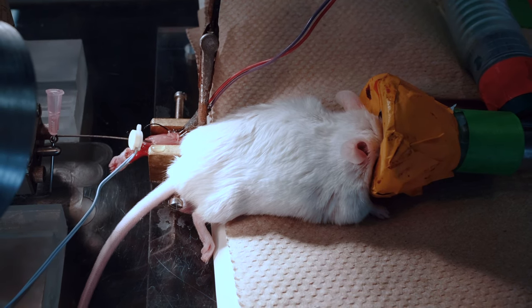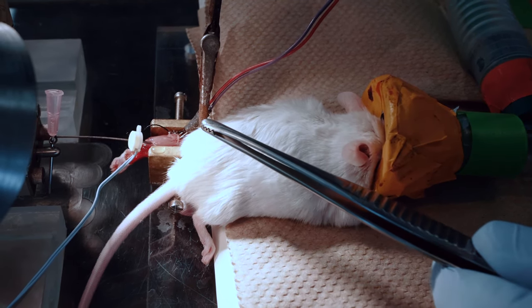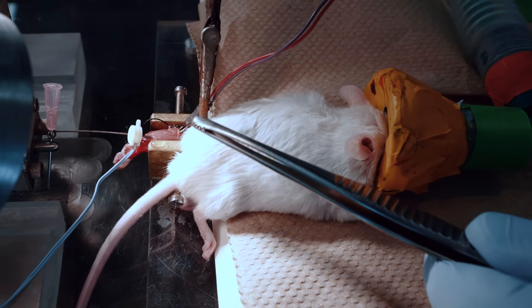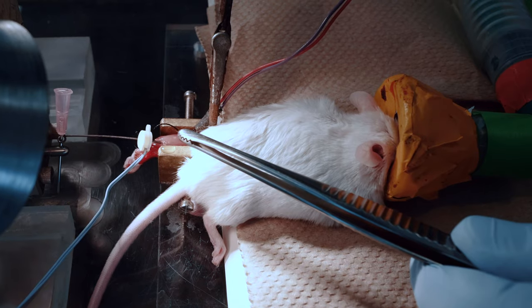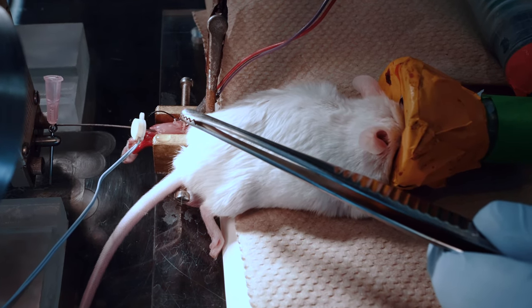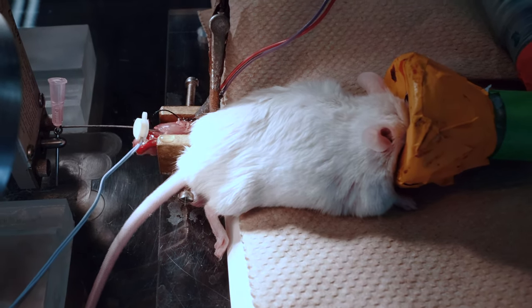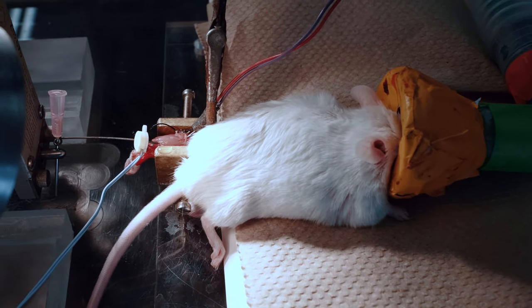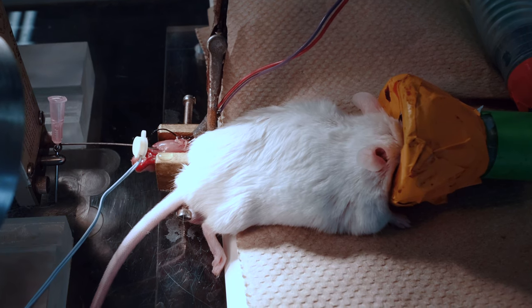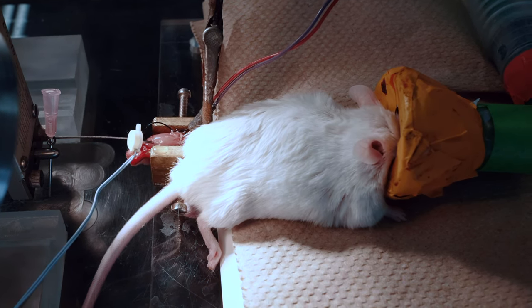What you can see here is the in situ hind limb muscle preparation. The gastrocnemius is exposed and being stimulated by this electrode attached to the sciatic nerve. The blue wire is a temperature probe monitoring the muscle temperature at around 37 degrees. The muscle is contracting now at one tetanic contraction per second — a model of exercise at pretty low intensity. If I want to change the intensity, I can increase the stimulation rate, and the muscle will contract twice as fast — like increasing the workload on a treadmill from one grade to a higher grade.